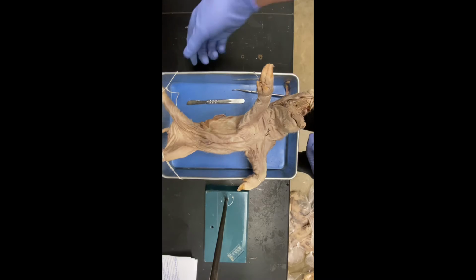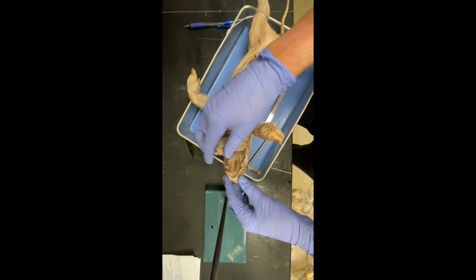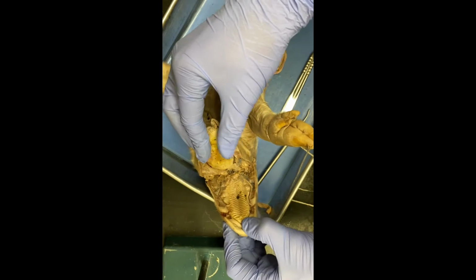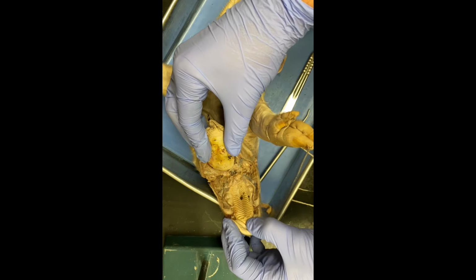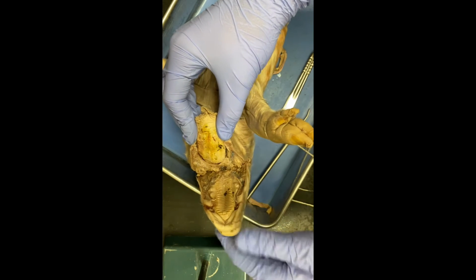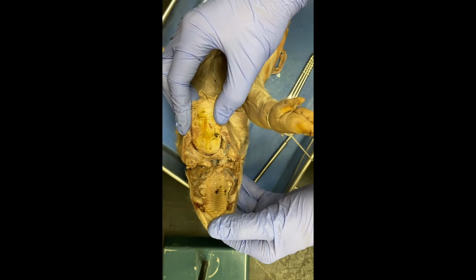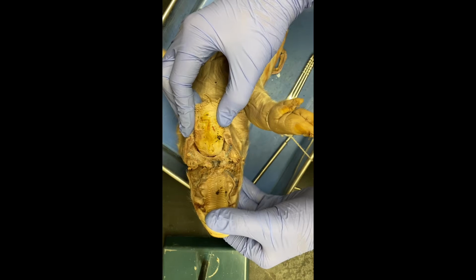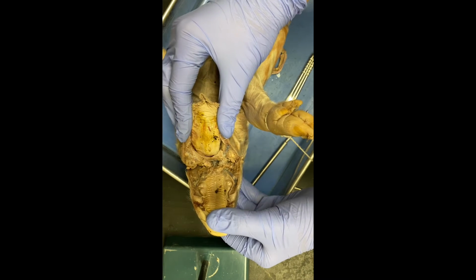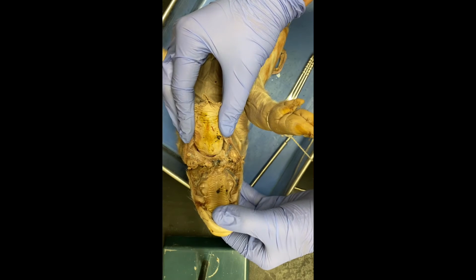All right, now we're going to go through the oral cavity of the fetal pig. So we can start with the tongue, which is right here. It's the big thing right here, and it manipulates its food with the tongue. It can also lick things, and the tongue has taste buds on it, which are used to taste the foods. So it helps identify what they're eating, if they've eaten it before, that sort of thing.